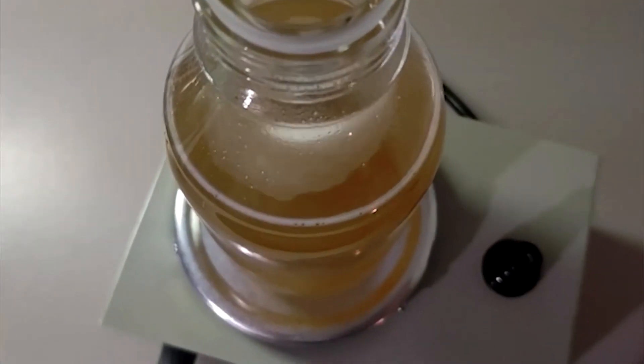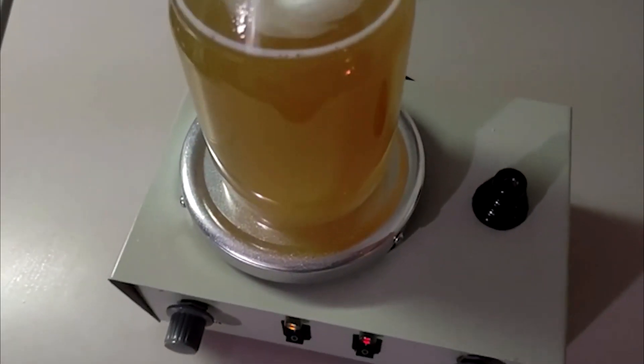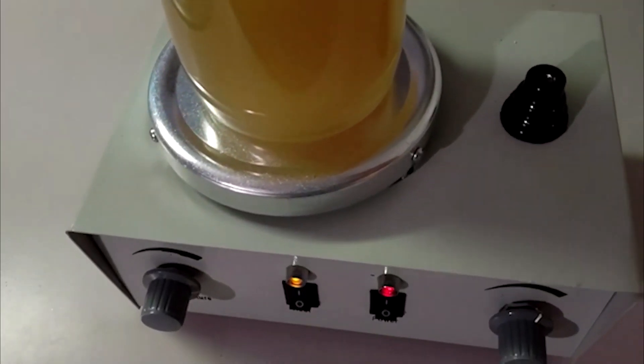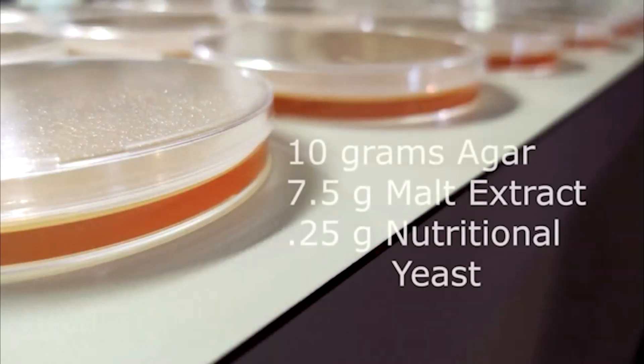When working with nutritional yeast, even when you create a fine powder, it will leave cloudiness and particulates in your agar. We've tried straining this out and it's still there, but it's okay. We have not experienced any contamination. It's been a really positive recipe with so much rhizomorphic growth, so the particulates and cloudiness are not a problem at all.